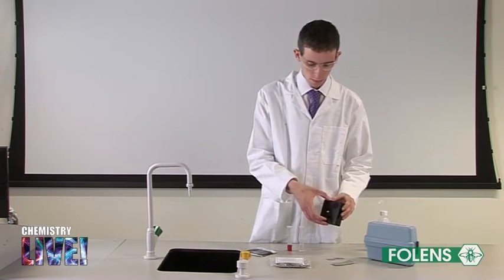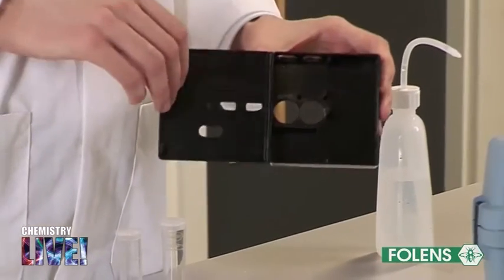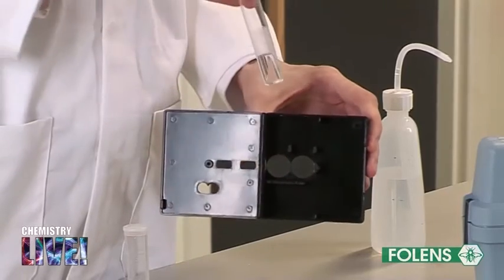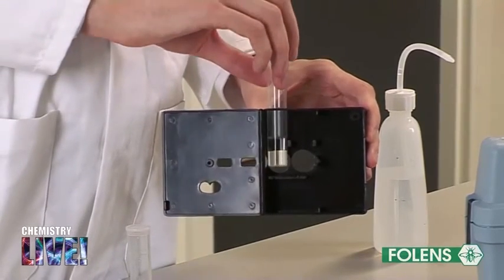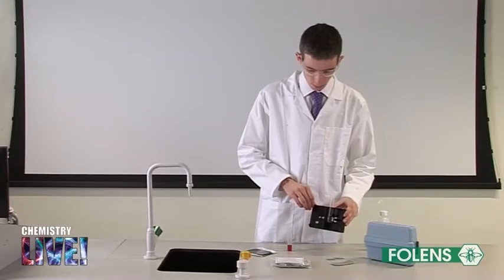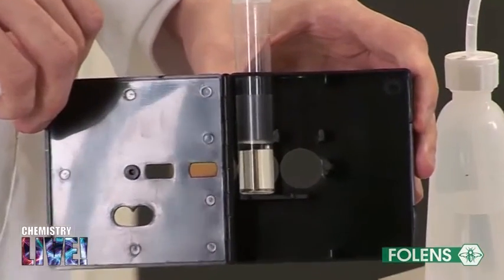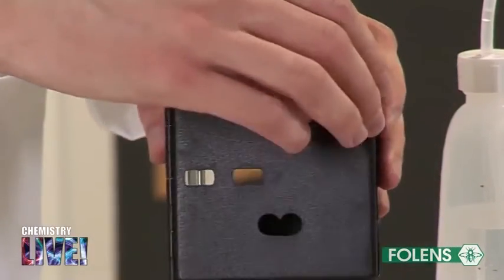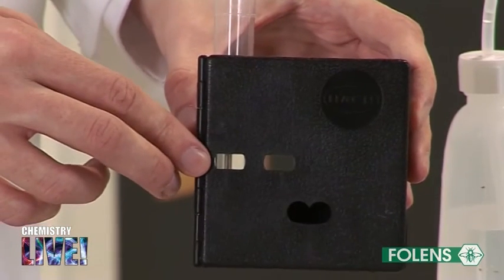Open the black coloured comparator box and place the tube with the clear water in the top left hand opening. Note that the level of water is just above the circular opening through which the light passes.